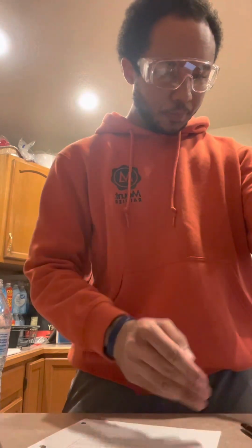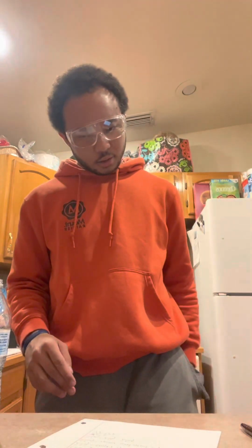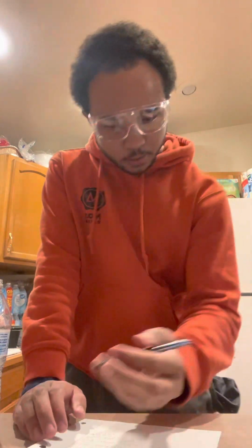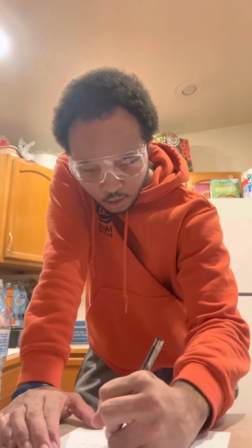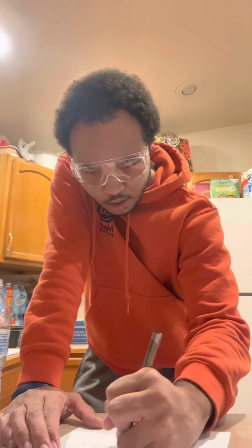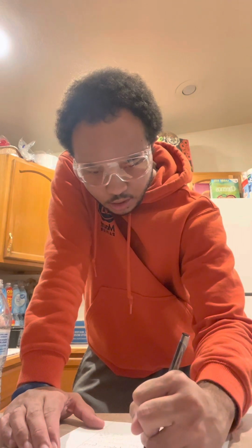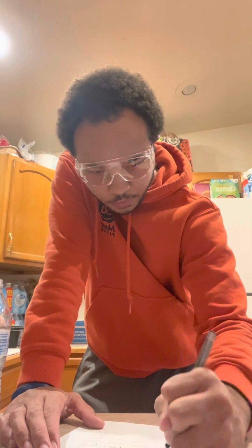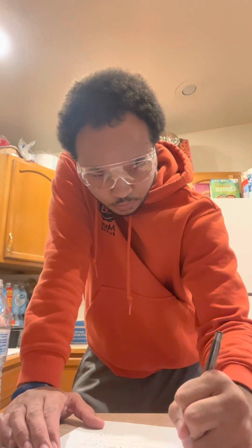And it reads about 21 grams. Yep, 21 grams equals the empty graduated cylinder. Okay.